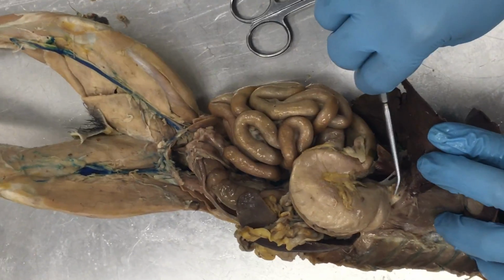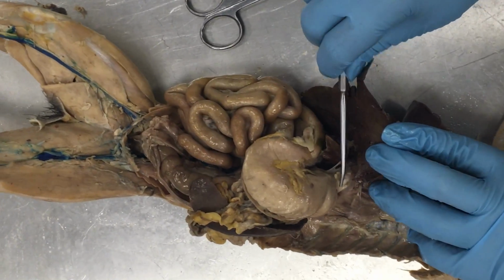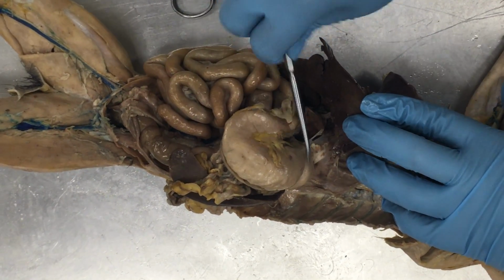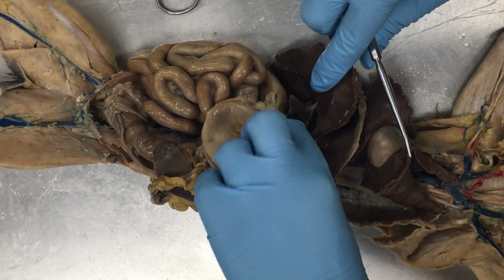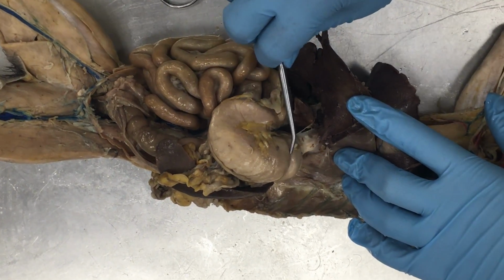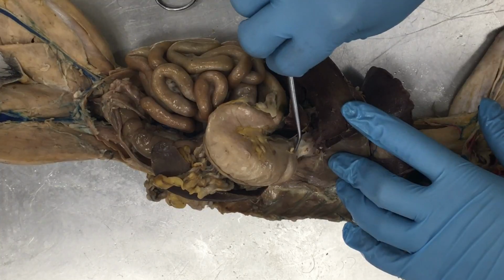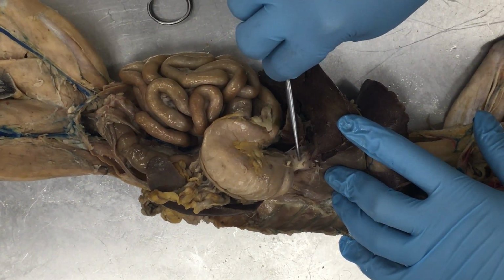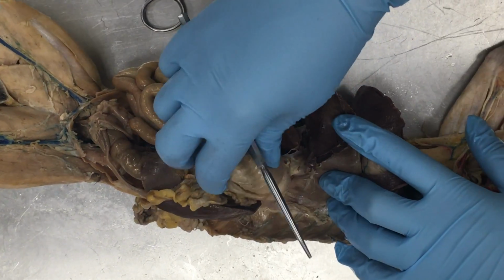So this is our cat's stomach. The end of the esophagus is right here. Where the esophagus and the stomach meet, right up here, there is a thick muscular ring. That's a sphincter that controls flow of substances between the esophagus and the stomach. Call that the gastroesophageal sphincter. Literally means gastro, stomach, esophageal, esophagus. It's the sphincter between the stomach and the esophagus.